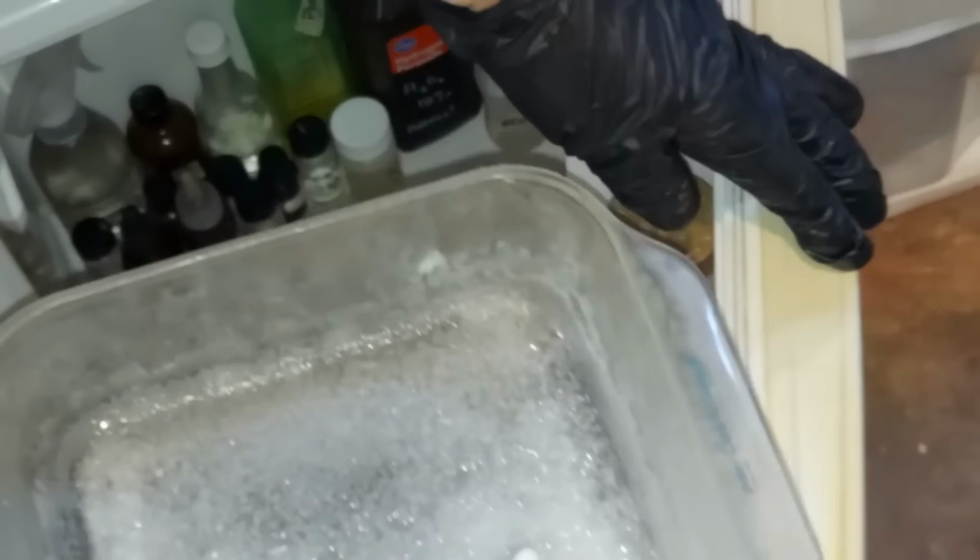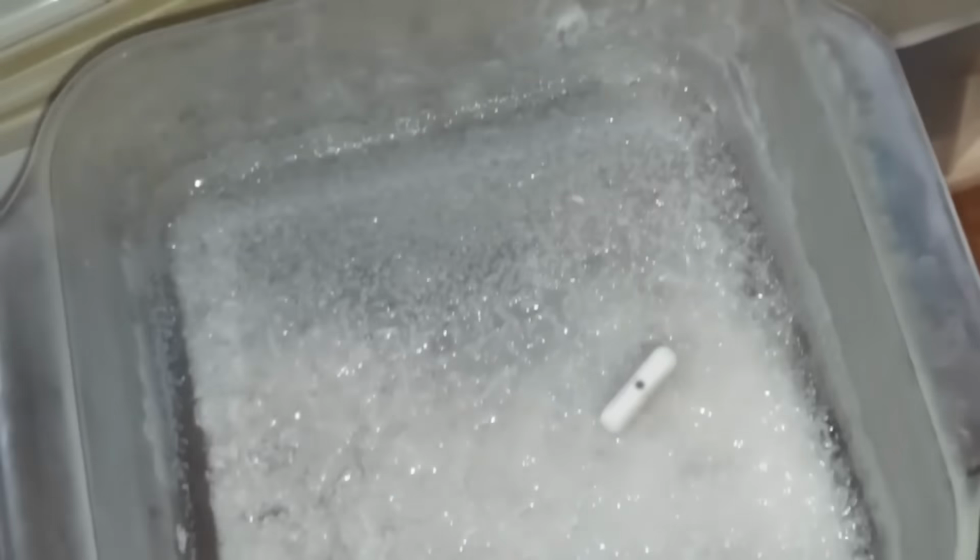All right, there we go. That's looking pretty good right there. It just needs to be vacuum filtered, and then we'll wash it with a little bit of cold water. This is a funnel that I cut the bottom off of so that it would fit on top just like that, which definitely helps.